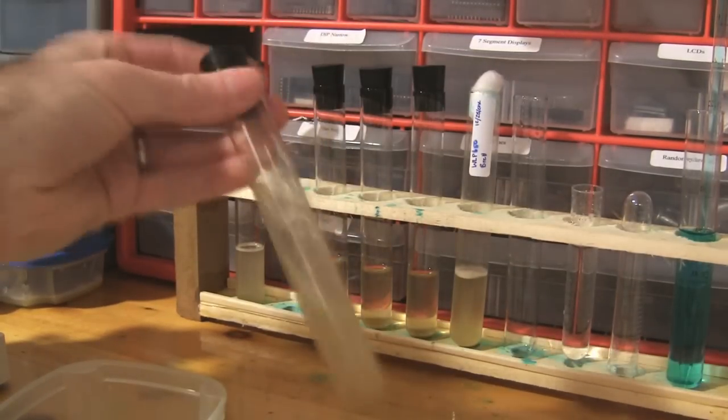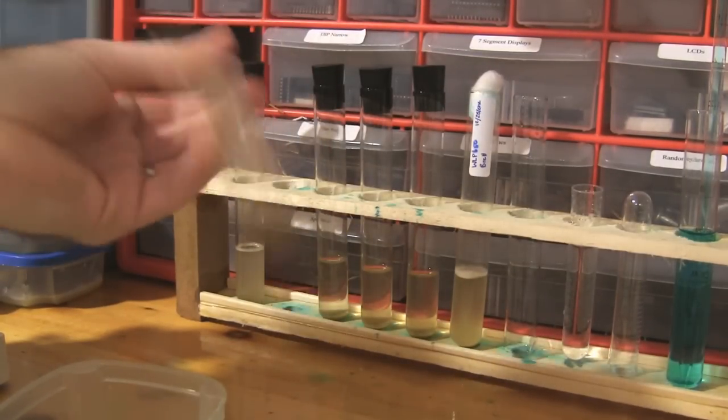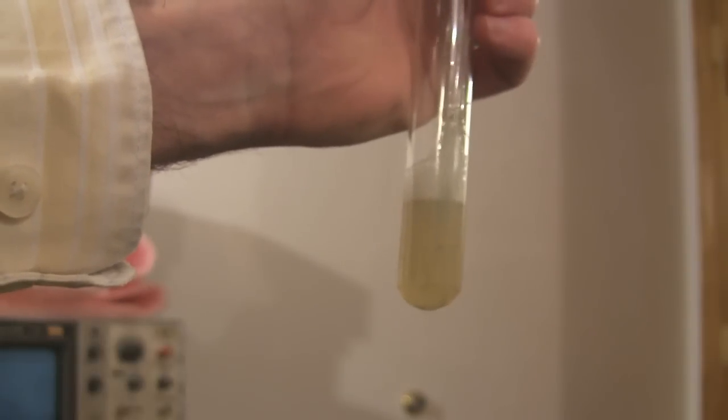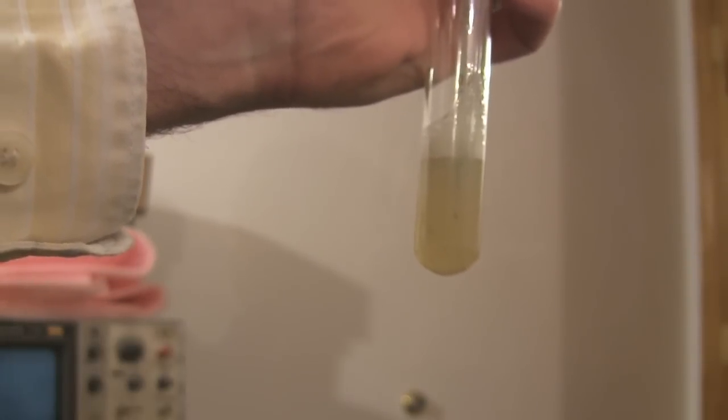When working with a sample, you want to make sure that it's well homogenized. And when you pull it, pull it as accurately as you can.